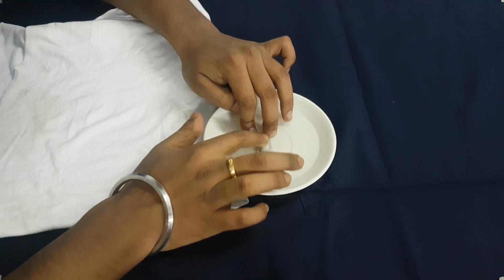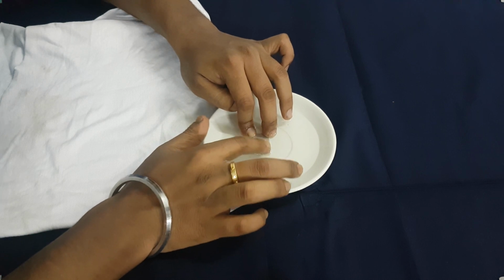I'm surprised even if the dimensions come less in this case, then it will prove that it will be little soluble.